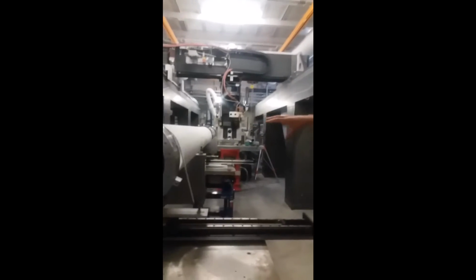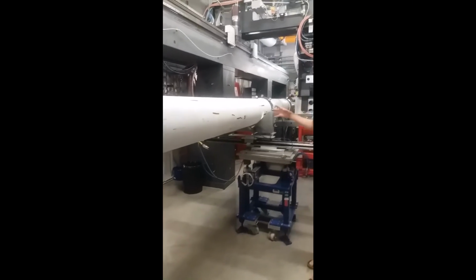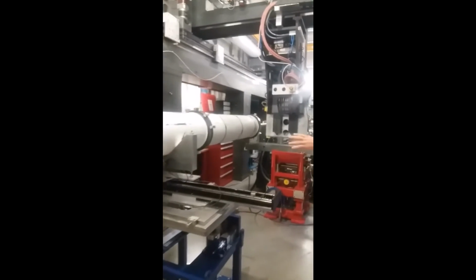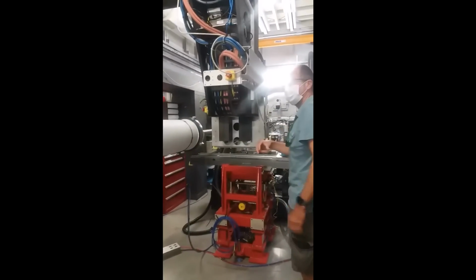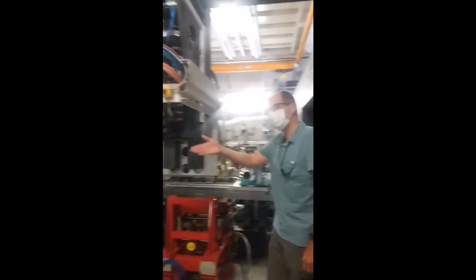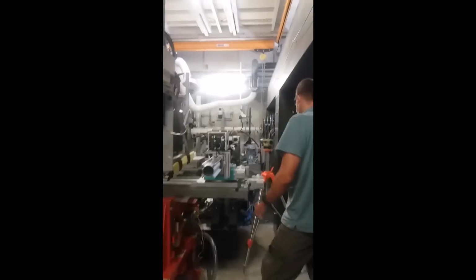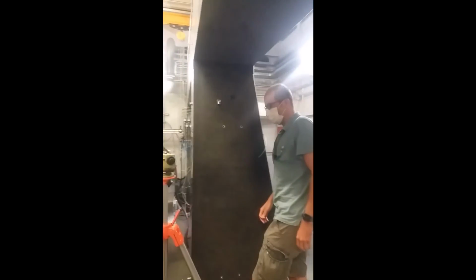Then we have a large flight tube. This is an evacuated flight tube where the X-ray goes, so we don't see the scattering from the air. Right? And this is why the hatch is so long, because we have to measure far away, but if you measure far away, you need to make sure that you don't have the background from the air scattering. And then you have the flight tube.